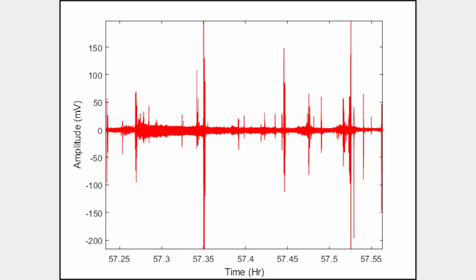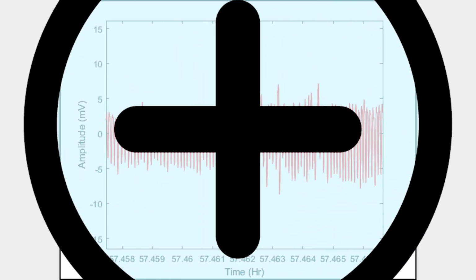Over this half-hour segment, bouts of stillness can be observed, broken up by short twitching, stirring, and posture changes. These flat-like regions at low levels illustrate the stillness patterns that have a high correlation with sleep, and when the animal is still, the only pressure on the cage floor is from breathing. This can be observed by zooming in further.